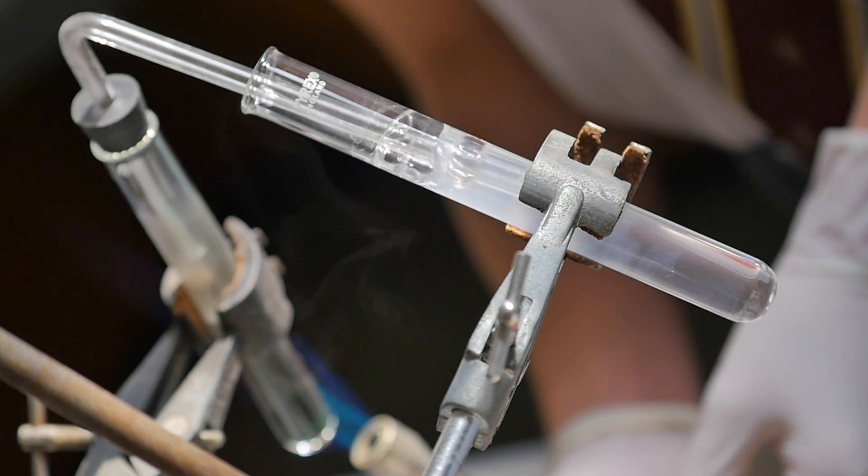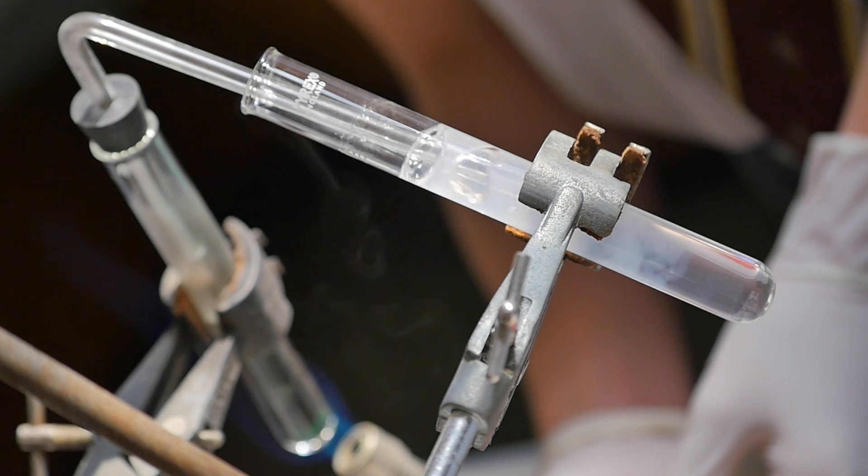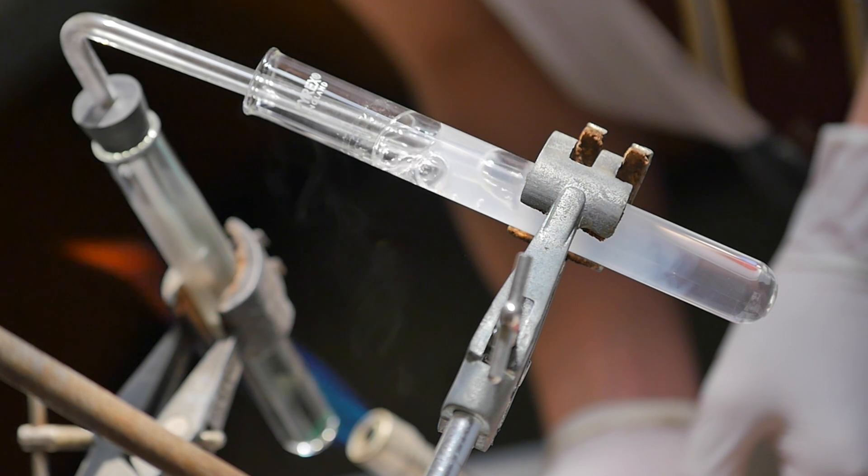CuO, which we presume is this black color there, solid. And the other material that we created is CO2 gas, which is what we detected over here. The lime has reacted.